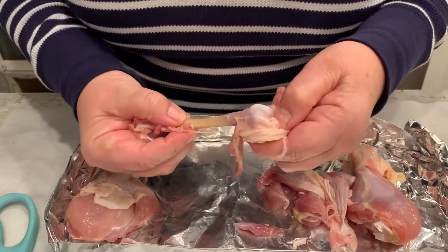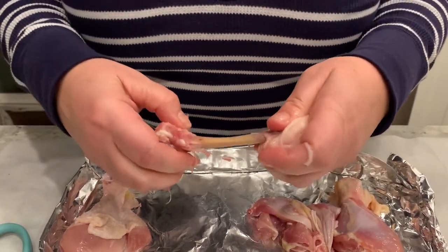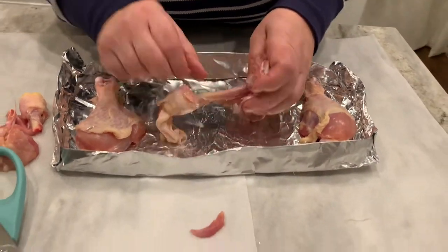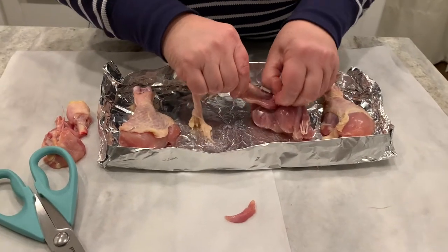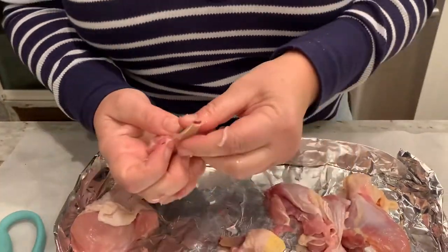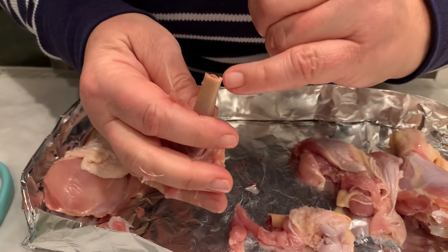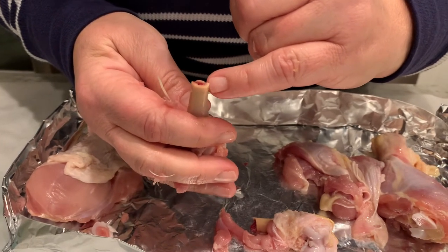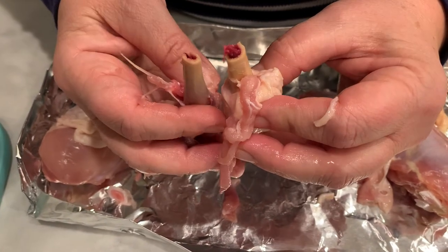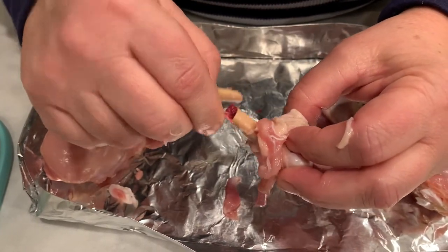Taking a good look at the joints — we have a fracture here now. This is the diaphysis of the long bone. The outside of the bone is called the periosteum. The inside is the endosteum, and now you can see the medullary canal. Within the medullary canal you can see the red marrow and the spongy bone.